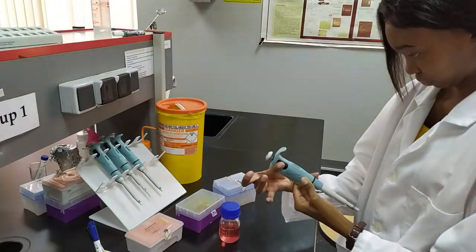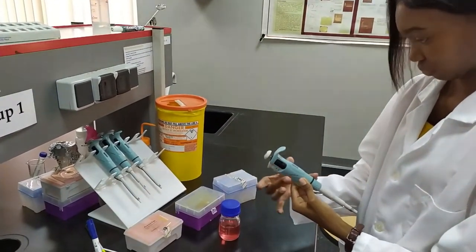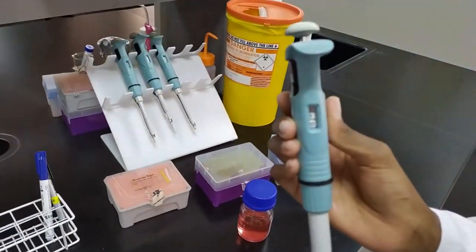Well, I've asked my assistant to help me demonstrate. First she's going to take her P1000 and set it to 100 microliters.